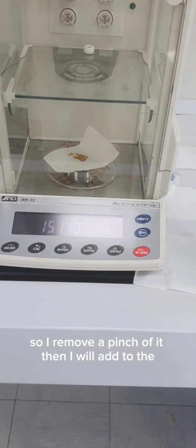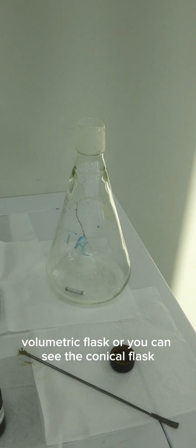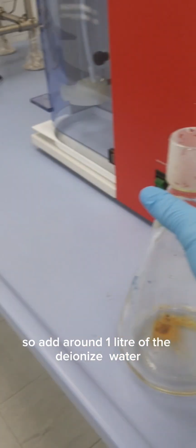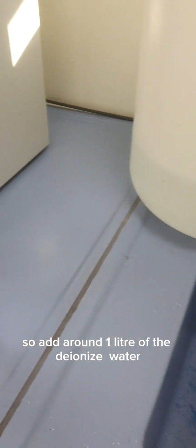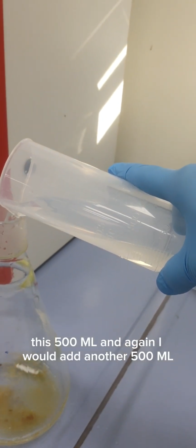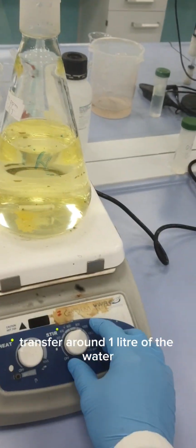So I'll remove a pinch of it. Then I will add it to the Erlenmeyer flask, or you can say the conical flask. The second task is to transfer the deionized water. So I'll add around 1 liter of the deionized water. This is 500 ml. Then again I would add another 500 ml, to transfer around 1 liter of the water.